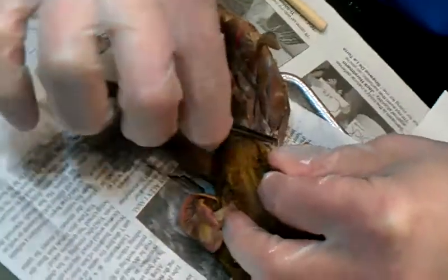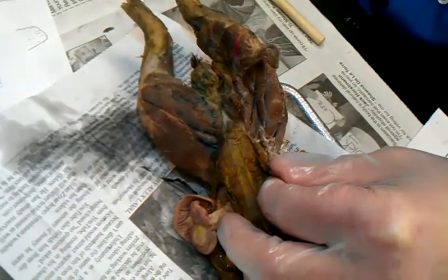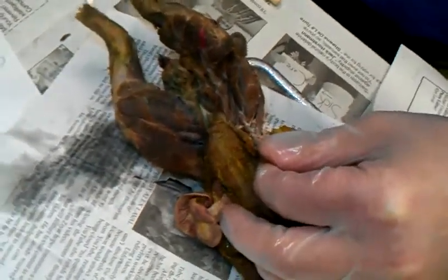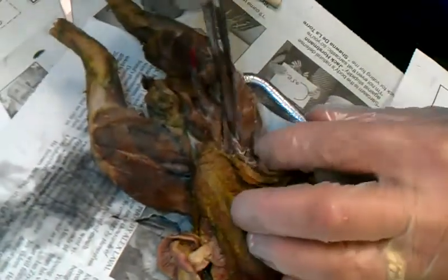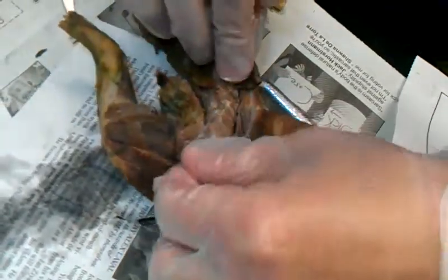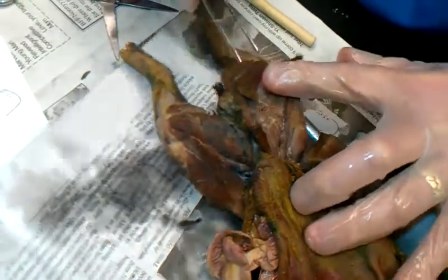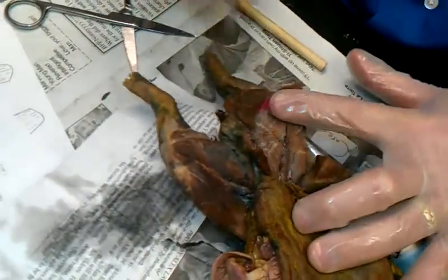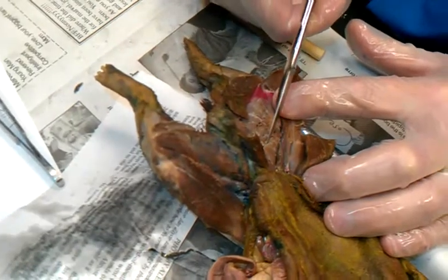So what's that muscle right there? You guys have it separated really nicely. The first one is not on the diagram — I would just write pectineus, but write it above adductor longus so they go in order. So you've got the pectineus, the adductor longus, and you guys haven't separated out a... this muscle's not coming apart anyway. You've got to look for some kind of logical separation. It's going to look a lot different than what it looked like on the last mink — remember I said this muscle will just kind of come apart in a bunch of different areas?